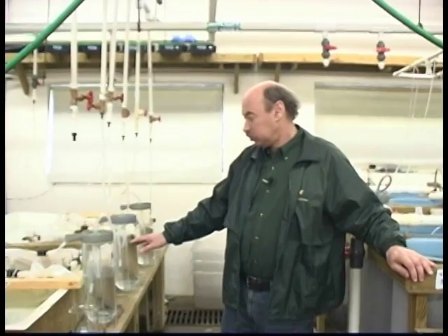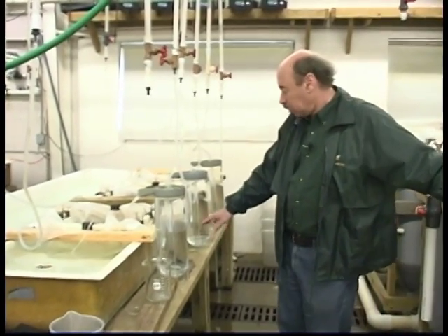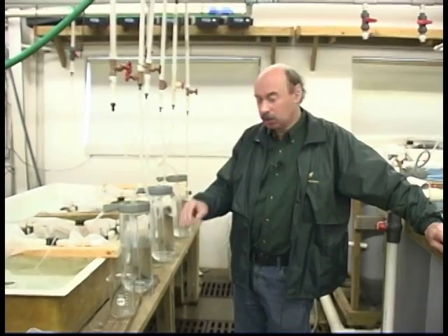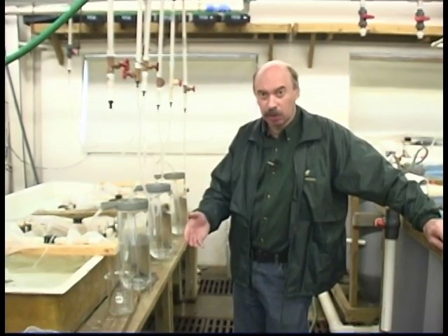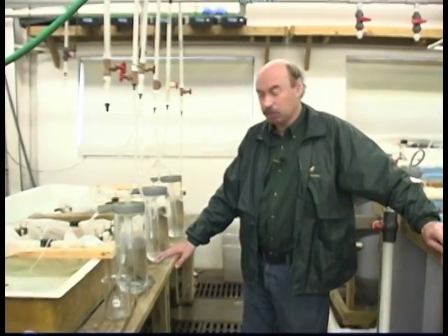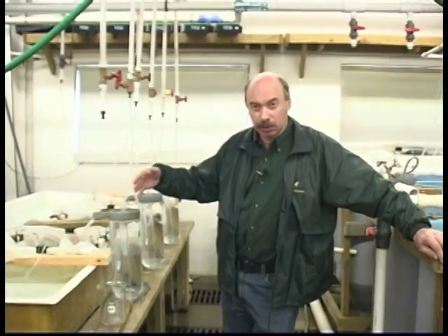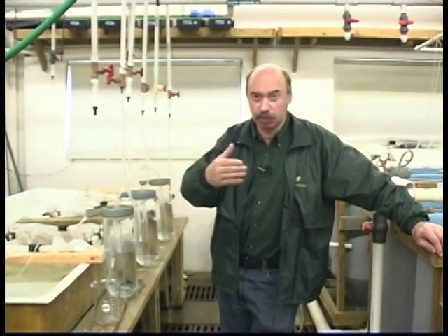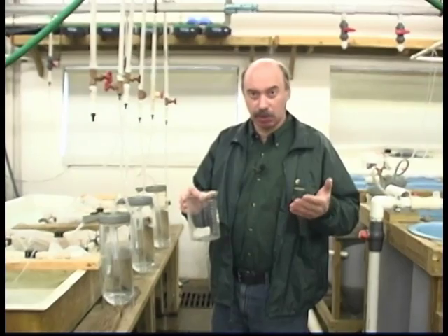Last time, I showed that hatching was finishing. In the McDonald jars, after all viable larvae swim out, there were some unhatched embryos and morphologically abnormal ones left. I cleaned the McDonald jars, and in three days — actually now — all larvae have already swum up. They swam up yesterday. Today, we plan to stock them for further rearing in tanks or in ponds.